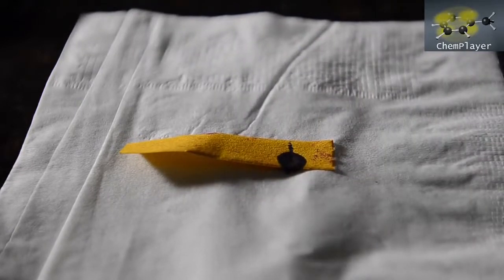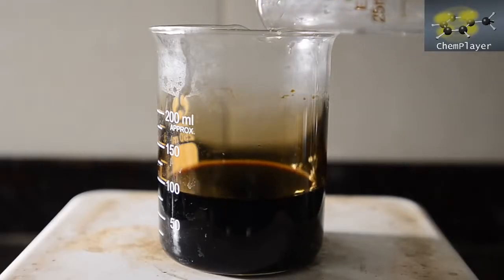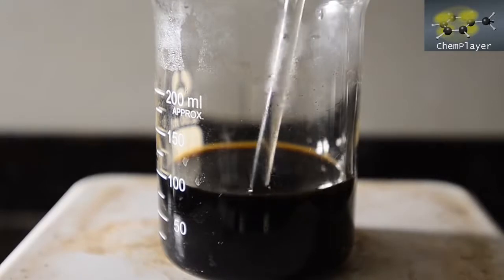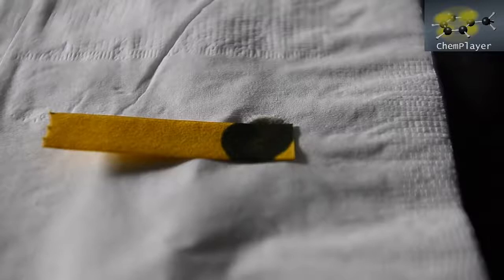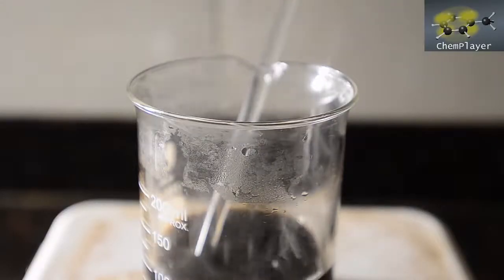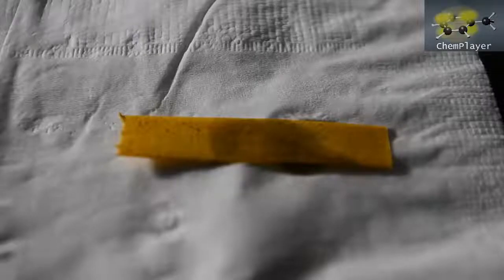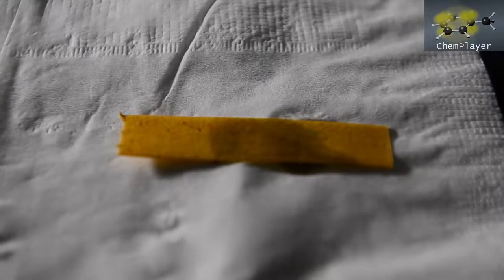pH is still strongly alkaline, so we've got a way to go. The mixture warms slightly and neutralization takes place. Slightly less alkaline now. Towards the end we add the acid drop-wise carefully. Definitely at between pH 6 and 8 now, although the color of the liquid makes it hard to tell.